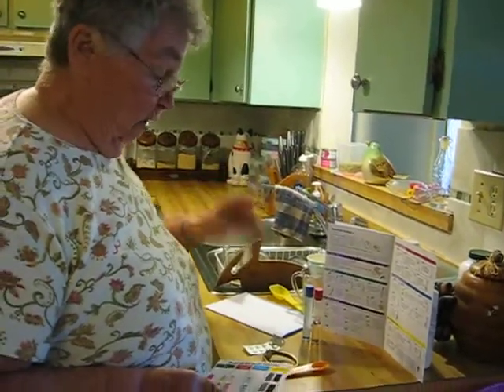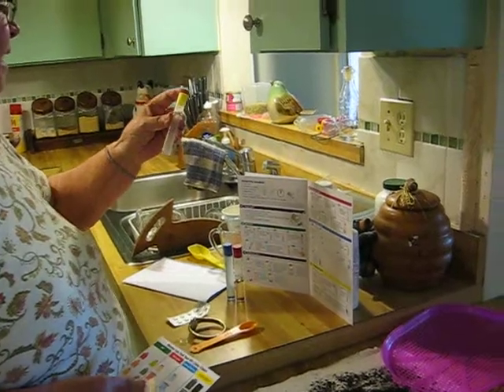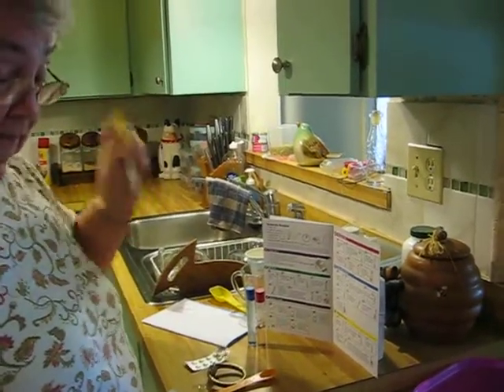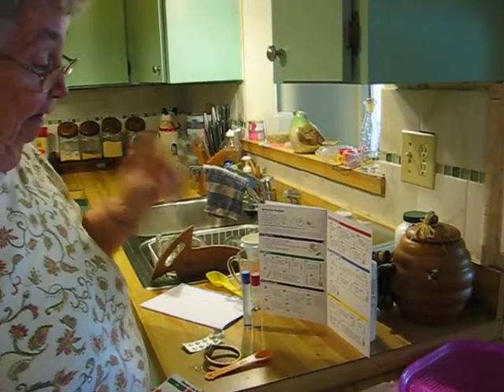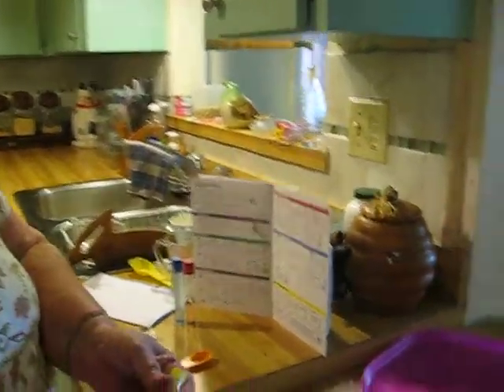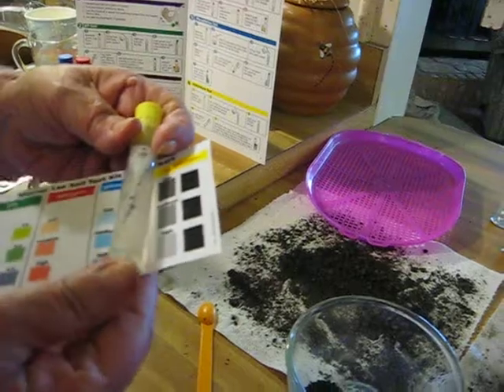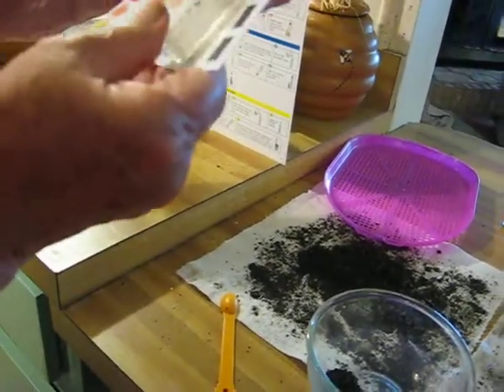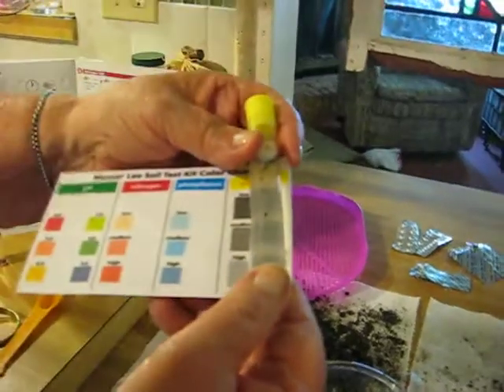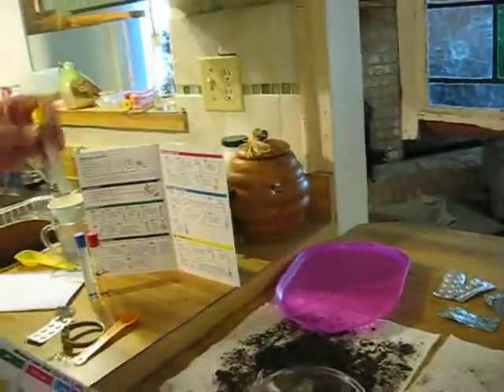This is going to be strange. I don't think shaking it up a little more is going to make much difference. It looks like it's going to be very high. Let's get it on the light color here. If you have it on the dark color, you can't compare it very well, so I put it side by side. No matter what I do, it's still high.